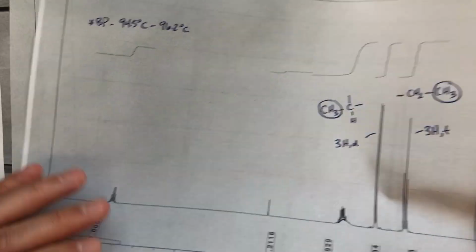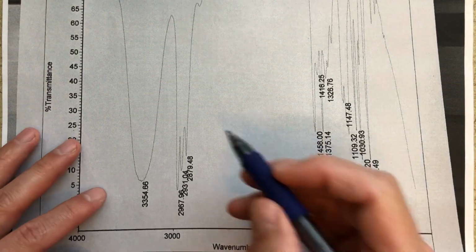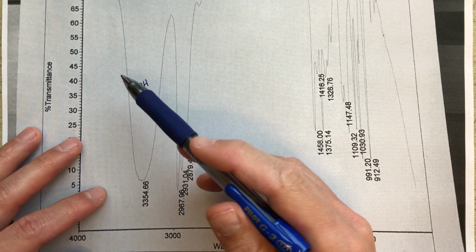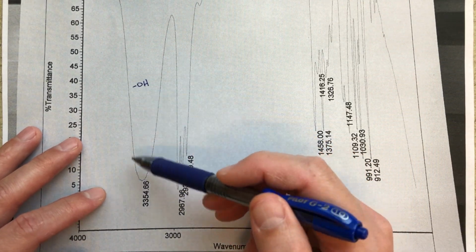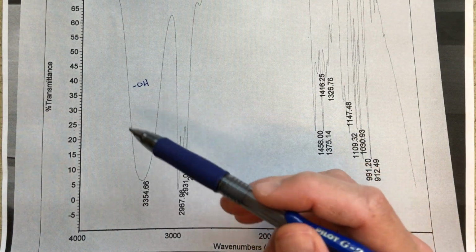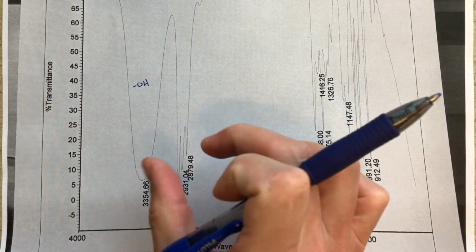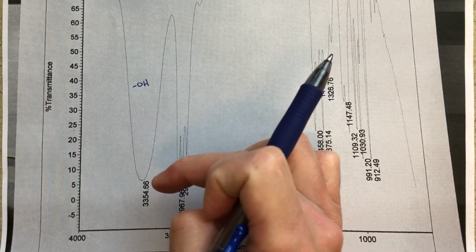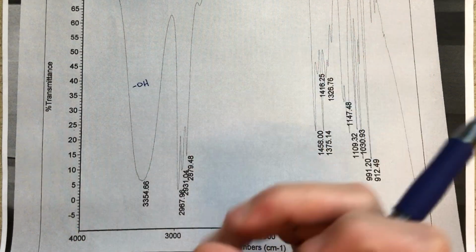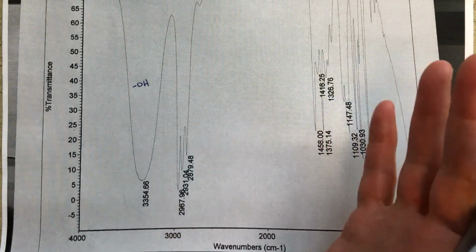And so when I looked at this IR, it's actually sort of funny because the first thing I did was sort of laugh almost. This is an alcohol, right? This is just so obvious and really just a nice IR spectrum. And this is very clearly an OH alcohol stretch. It's not a carboxylic acid. A carboxylic acid would be broader. It also would not be absorbing as much as this OH, but this is just a beautiful OH stretch. So clearly that is a functional group that we're going to have in this molecule.